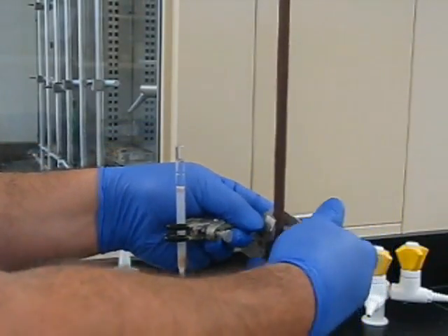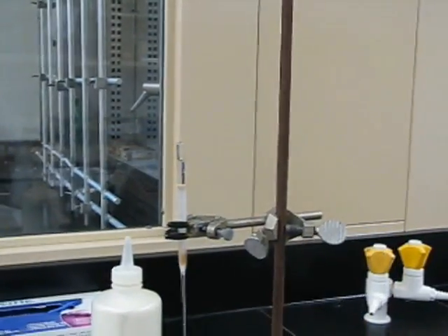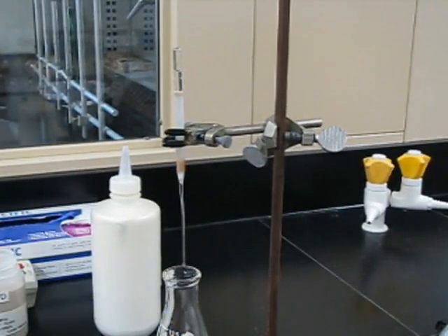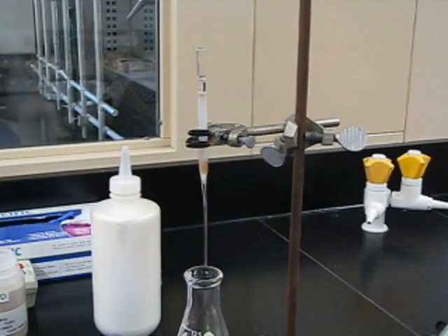Anyway, once that gets going, we can lower the pipette column so it's not dripping from, you know, five feet away into the flask. And watch the solvent in the pipette column going down and it coming out the bottom.